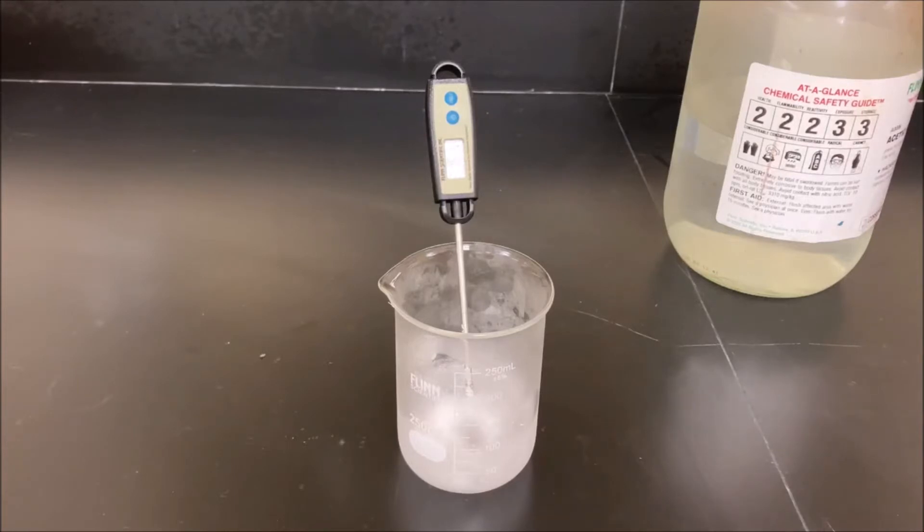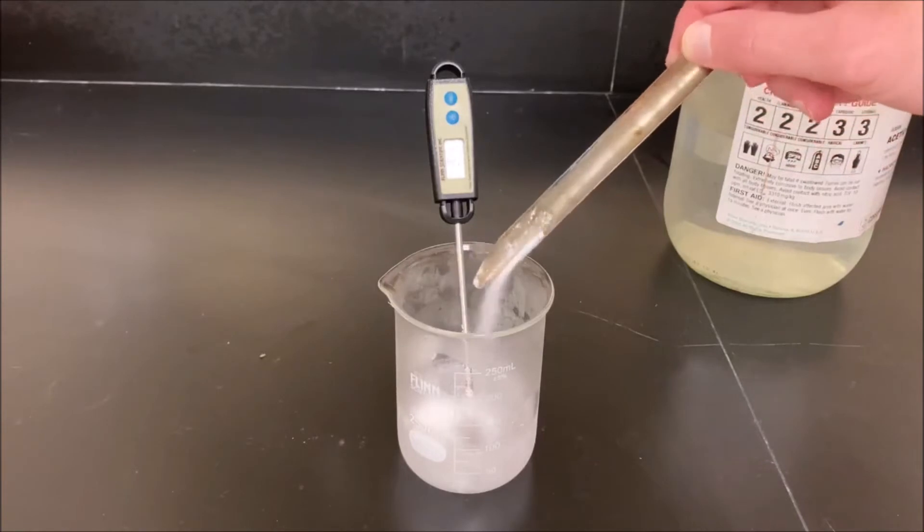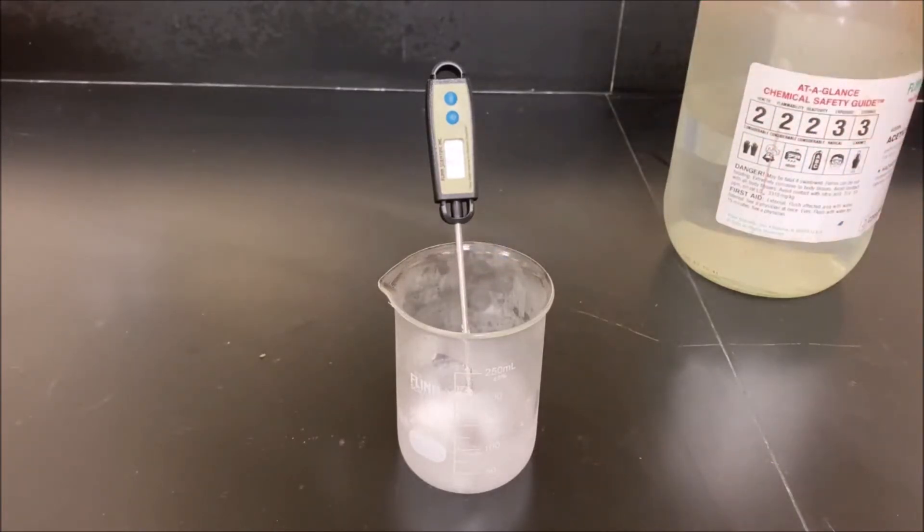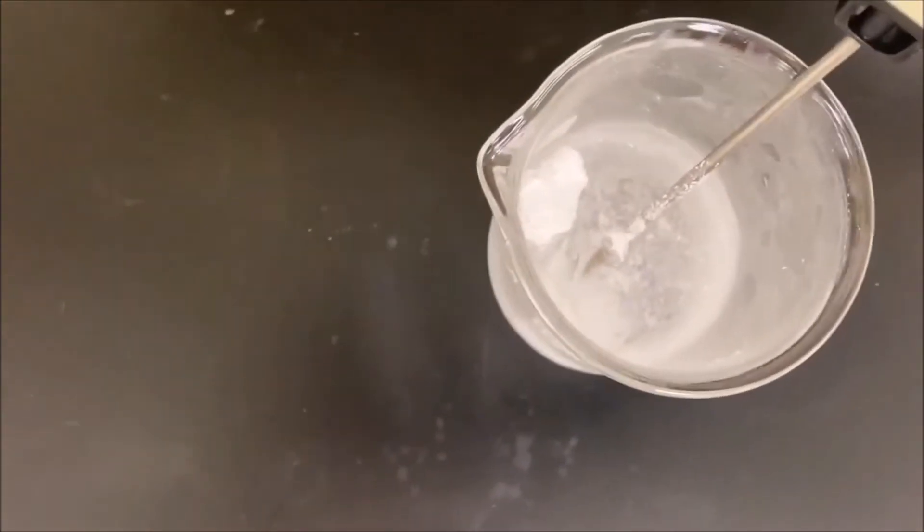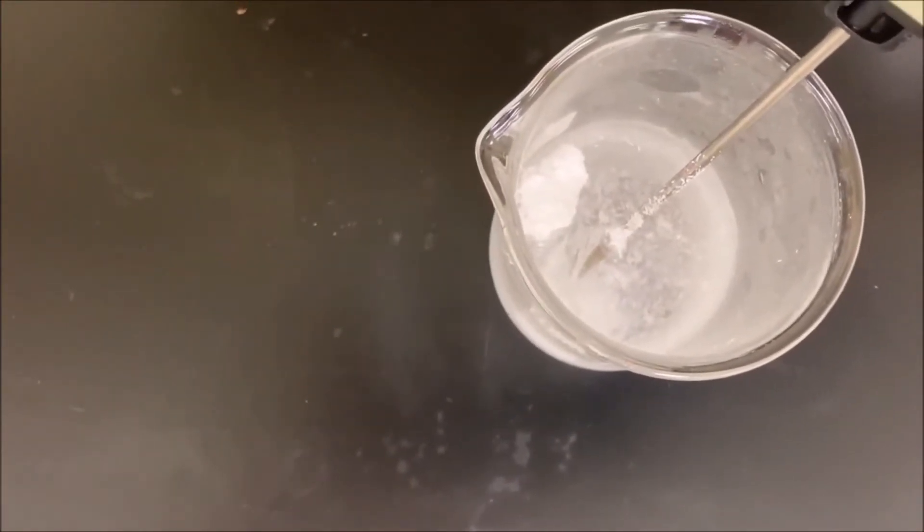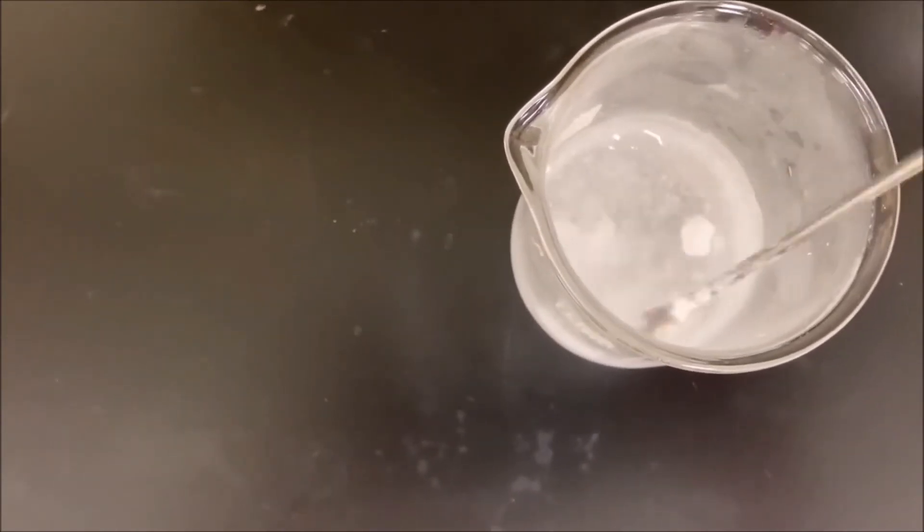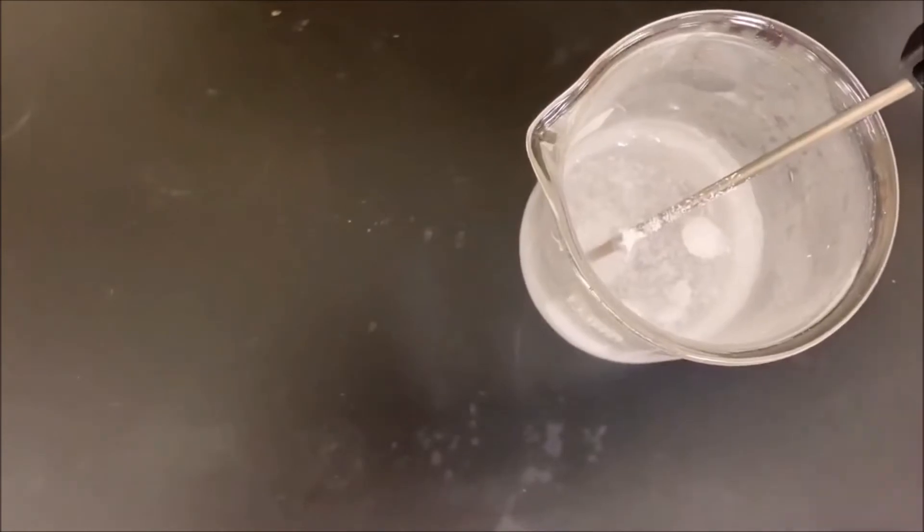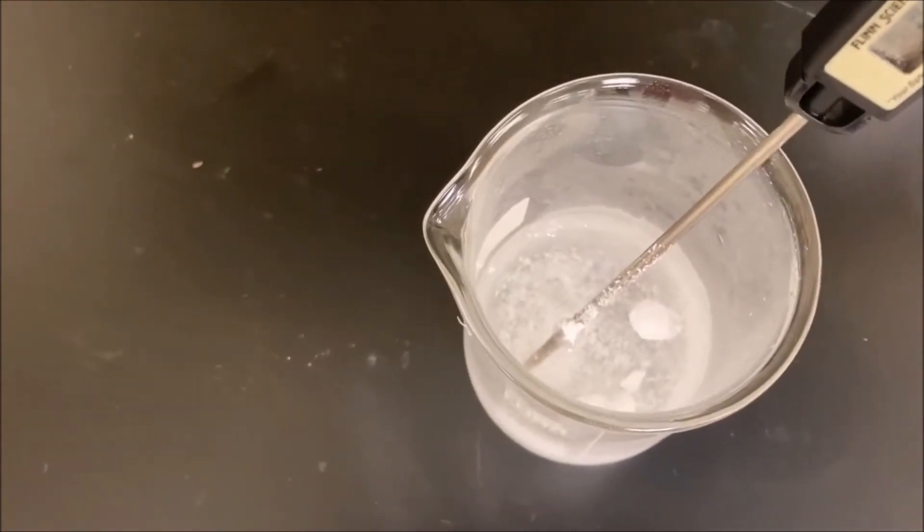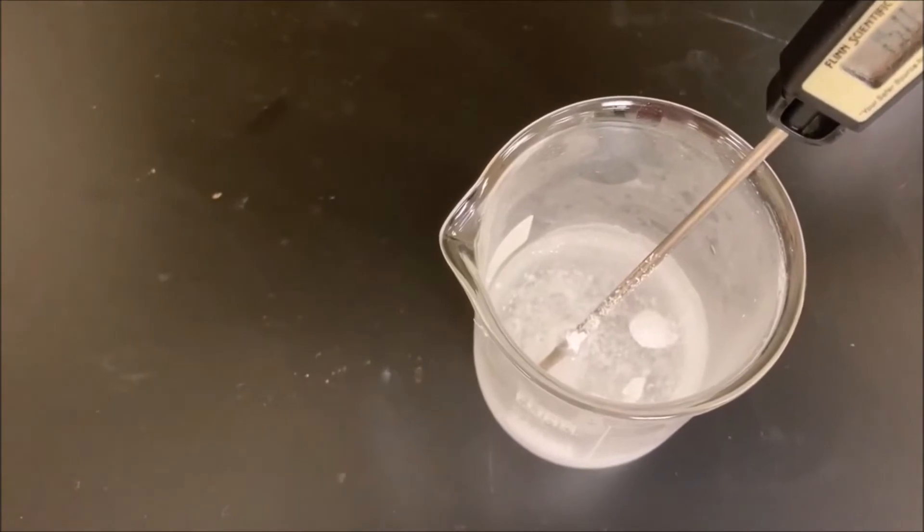So we're going to go ahead and see what happens here. That's interesting. There's very little bubbling going on. You could hear some initial reaction when they first mixed but not much happening since. I'm going to set this and just let it sit for a little bit and then we'll get our other sample.